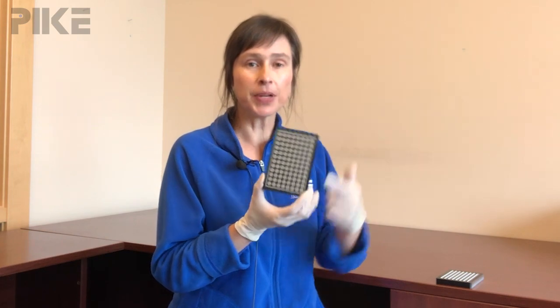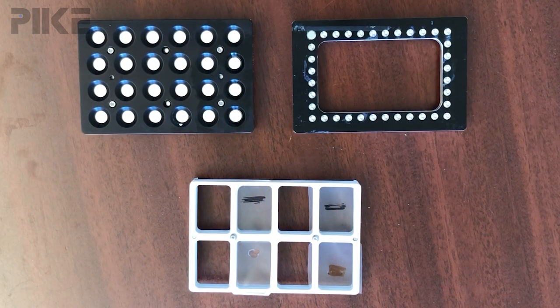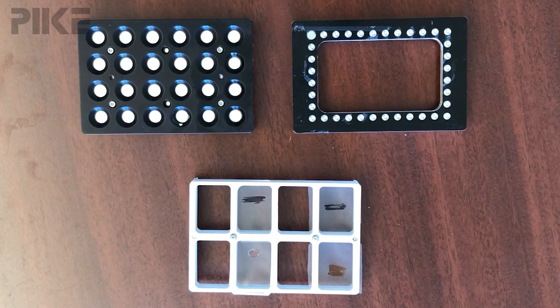The XY Auto Sampler is really flexible, and I'm going to show you some custom plates. If we can get a plate that works for your sample in the footprint of this microtiter plate, we can use it. So let me show you just a few of the many that we've done. Let's take a quick look at a few custom plates.